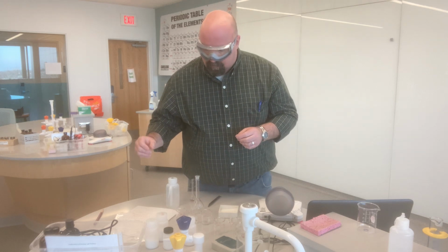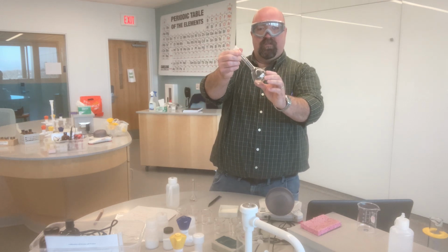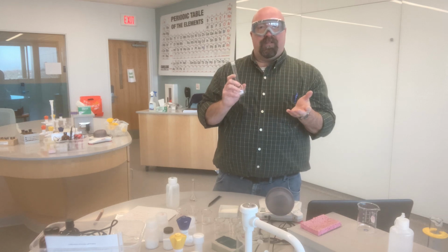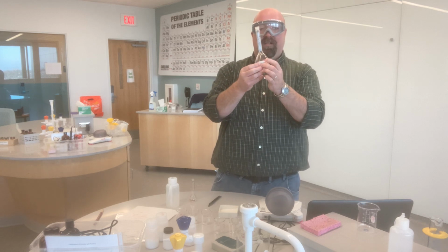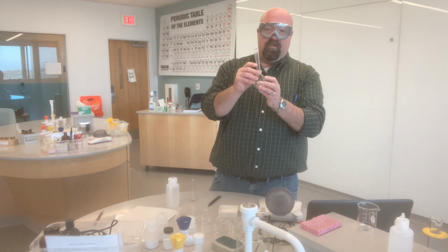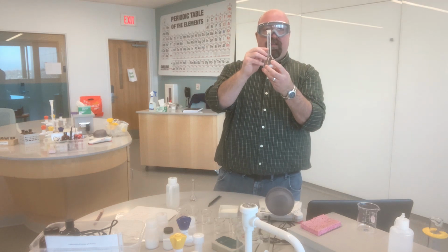And so I'm going to use volumetric flasks in order to make my solutions. Volumetric flasks look like this. I don't think we introduced those in Module 0. The whole idea of a volumetric flask is that this little guy's only purpose for existing is for making 100 milliliters of a solution. You can't see it from where you are, but I encourage you to just Google and look one up. There's a little line right here, and that line marks 100 milliliters.